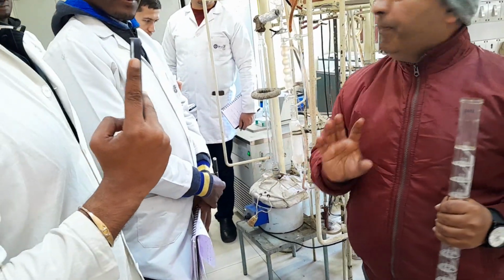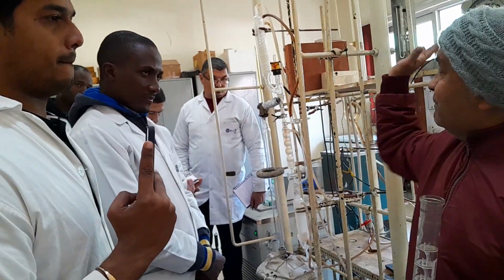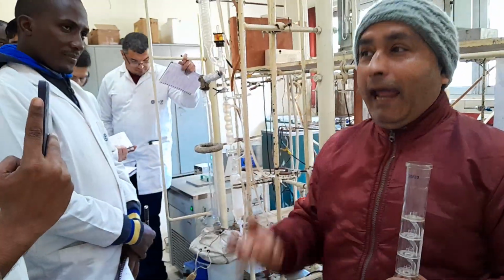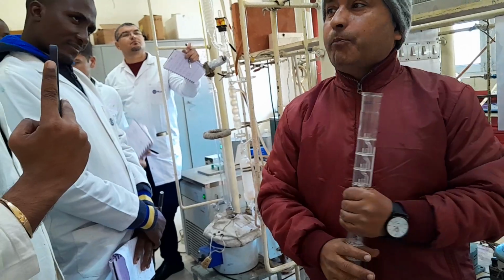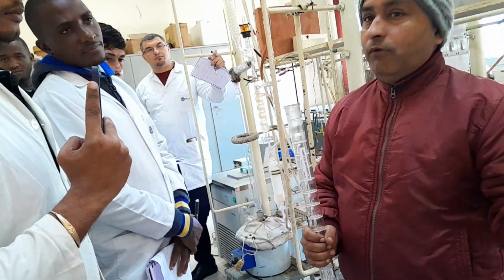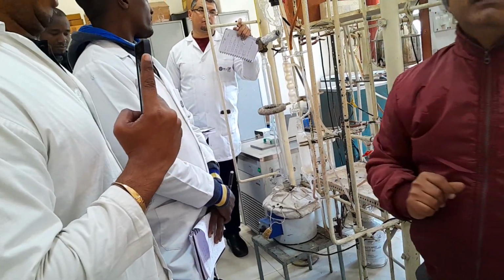Got it? Complete reflux. Now my duty is what? I have to collect the sample, I have to collect the distillate also. Otherwise, what is the use of that? If you are only sending the vapor back into the column, what is the use? So now my role is to collect the sample, and throughout the distillation you will have to send some liquid back into the column so that there is no disturbance of the column equilibrium. Okay. Once equilibrium is generated, then I will start my reflux.